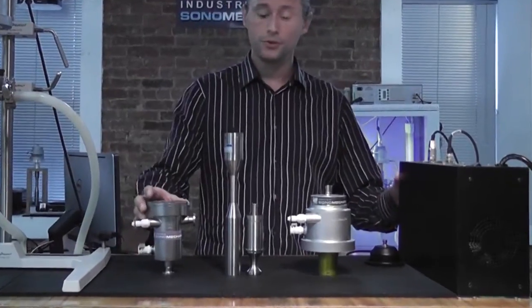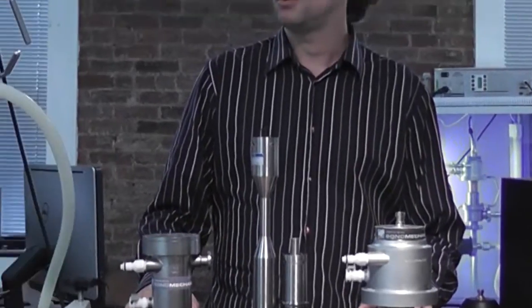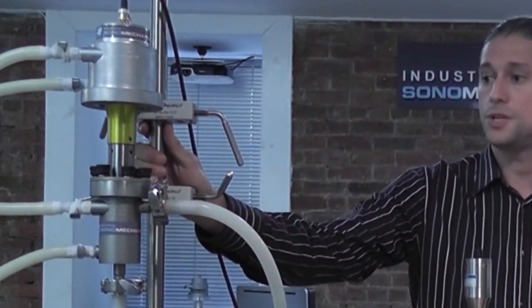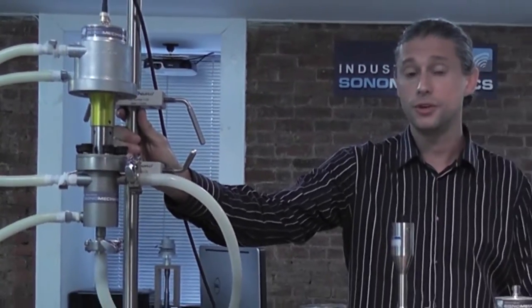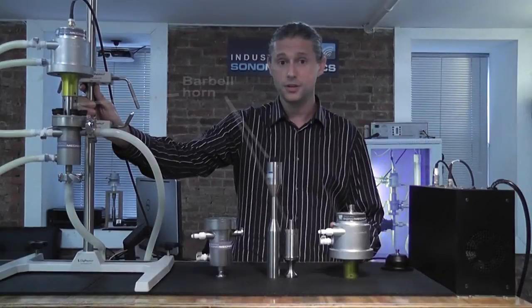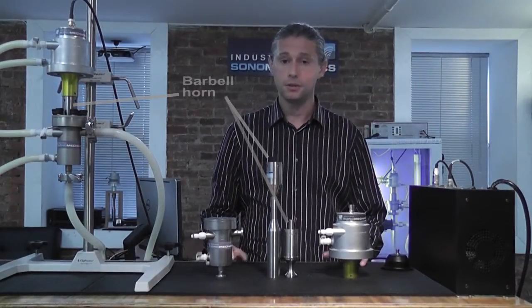I will first show you all major system components. I have them separately here. After which, I will show you how to disassemble the system in order to change the barbell horn, which is the part of the system responsible for delivering the high-intensity ultrasonic energy to liquids. After which, I will show you how the system can be reassembled.